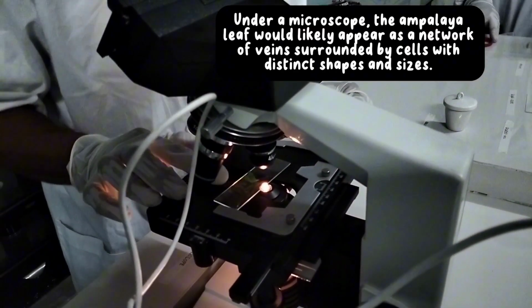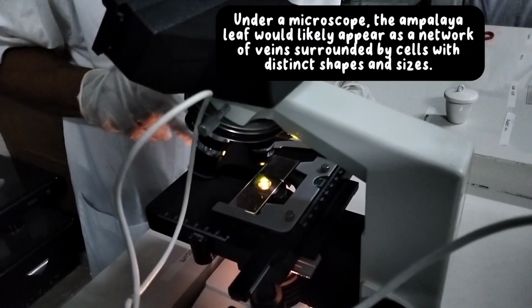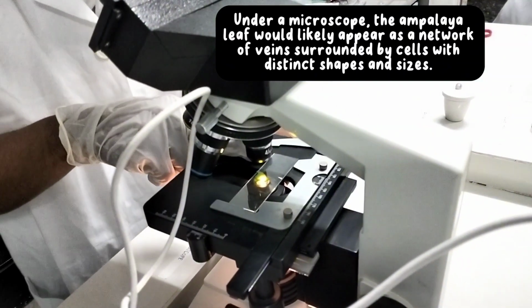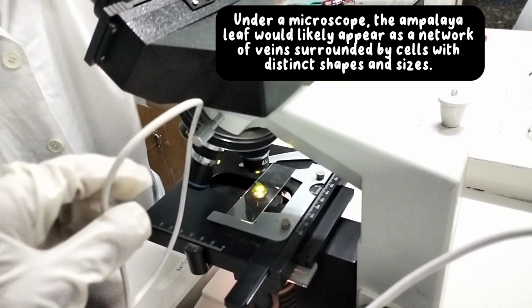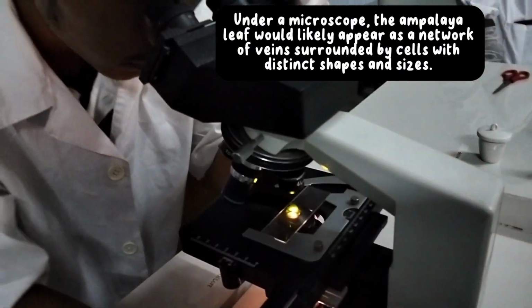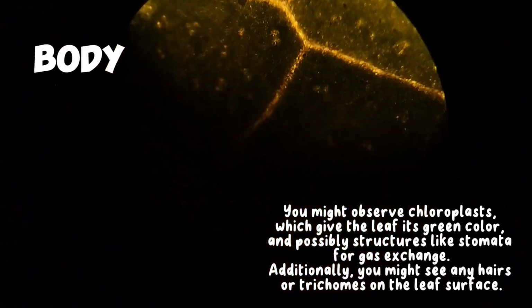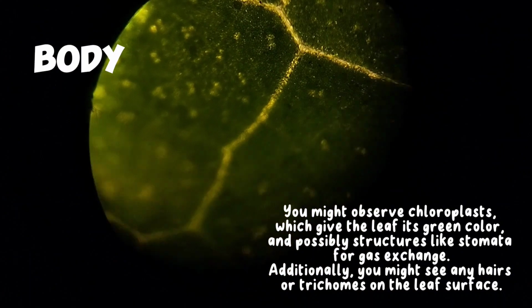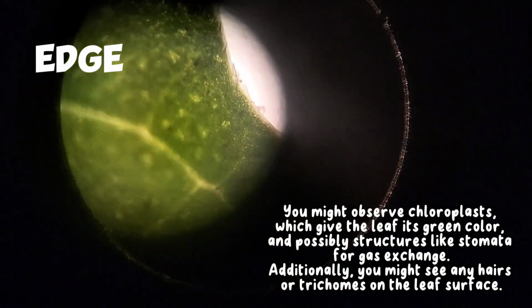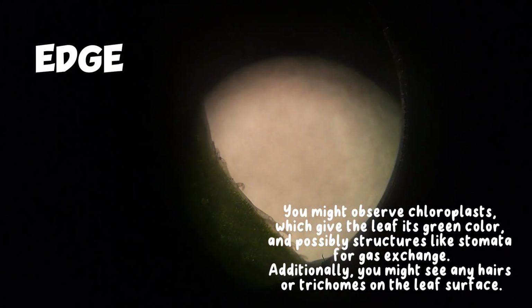Under a microscope, the ampalaya leaf would likely appear as a network of veins surrounded by cells with distinct shapes and sizes. You might observe chloroplasts, which give the leaf its green color, and possibly structures like stomata for gas exchange. Additionally, you might see any hairs or trichomes on the leaf surface.